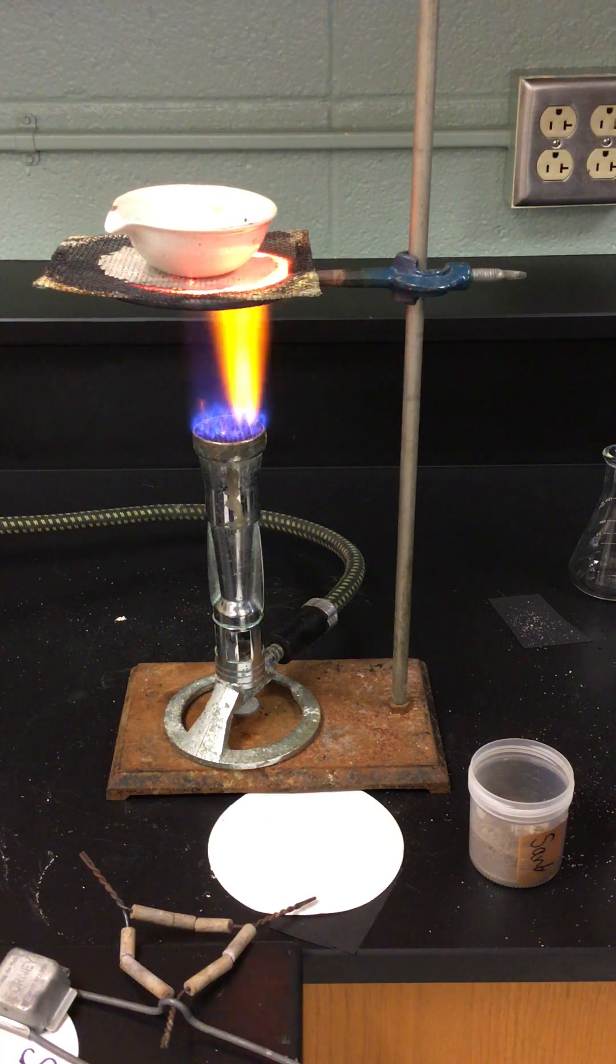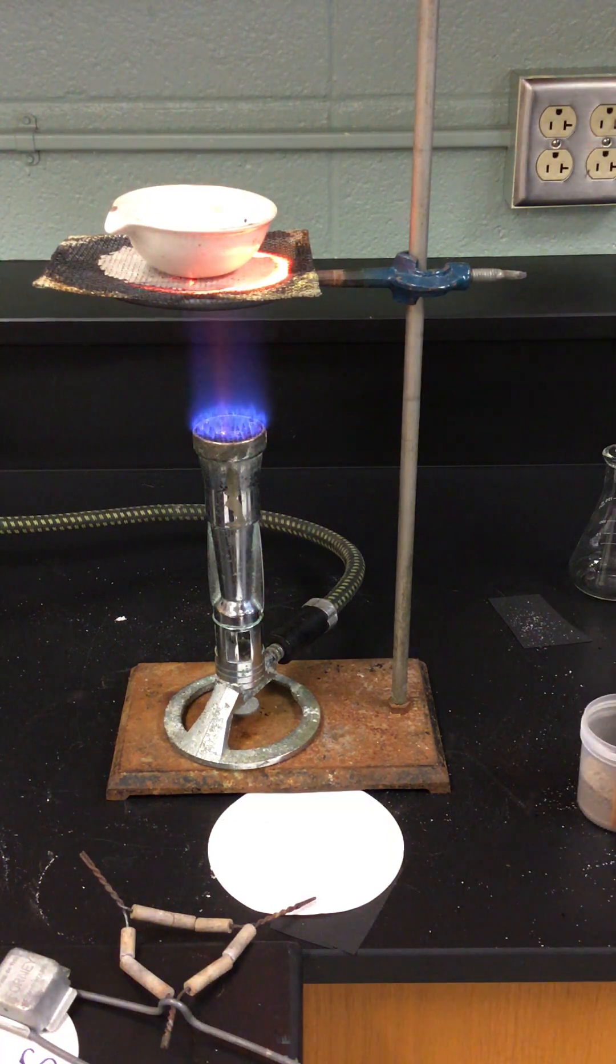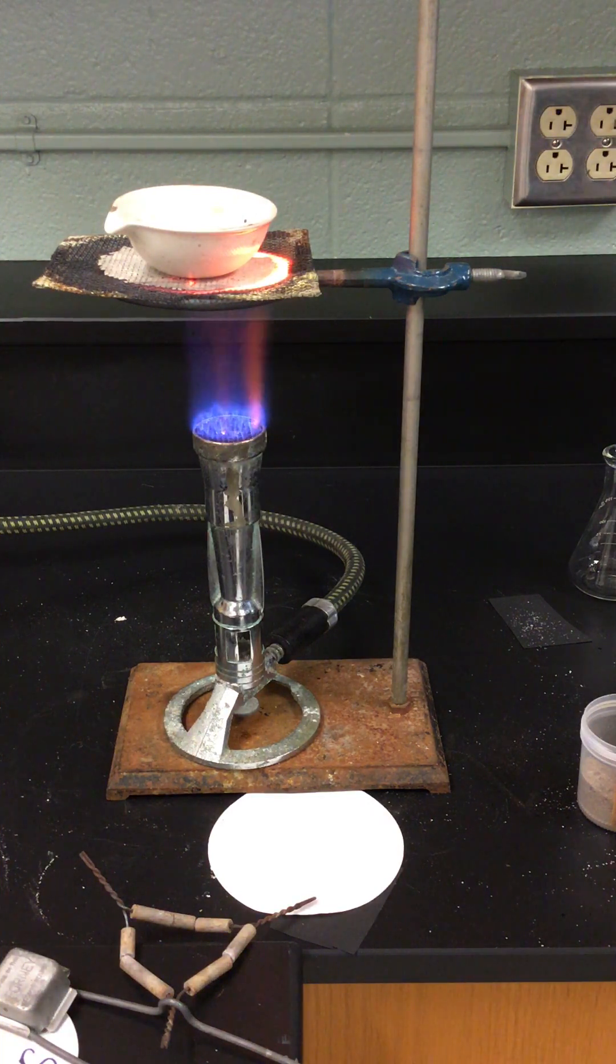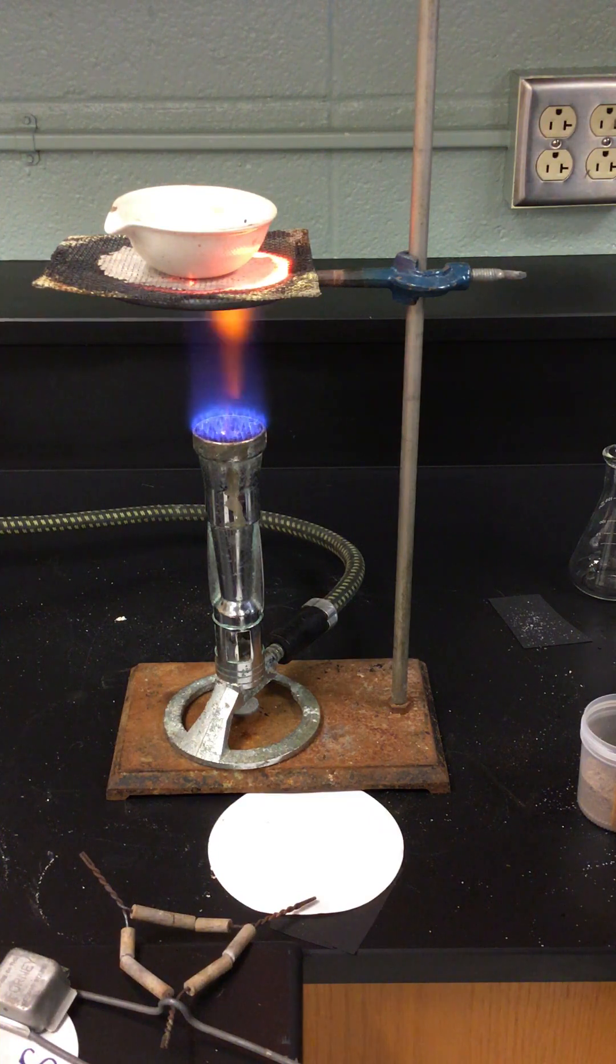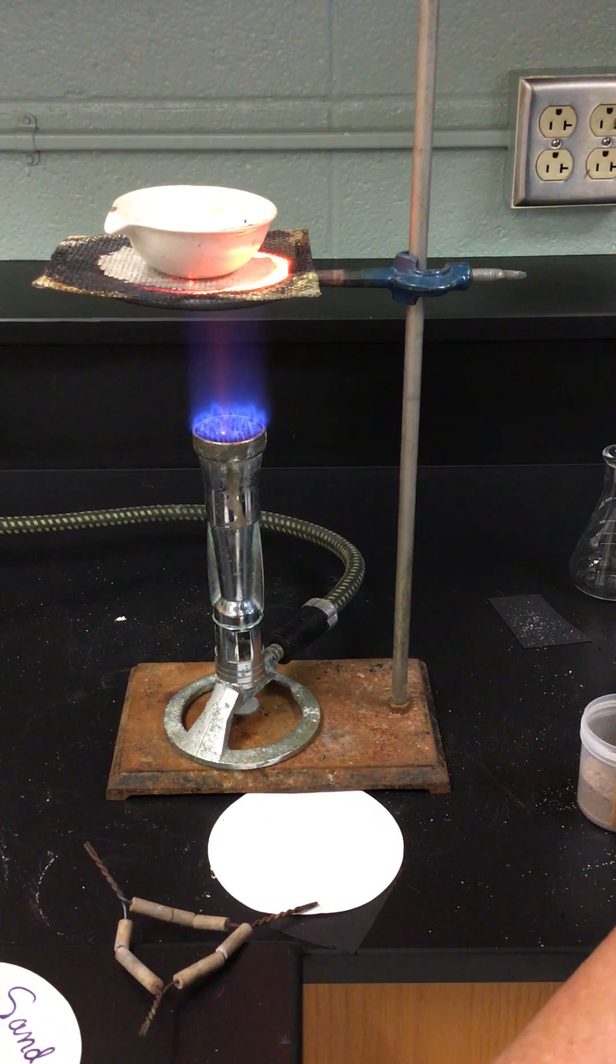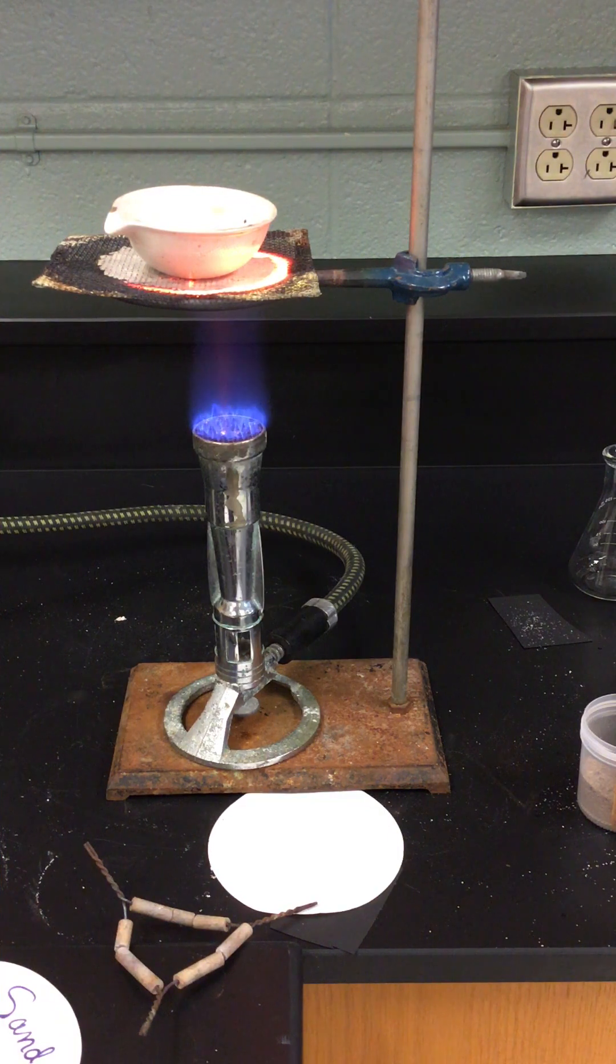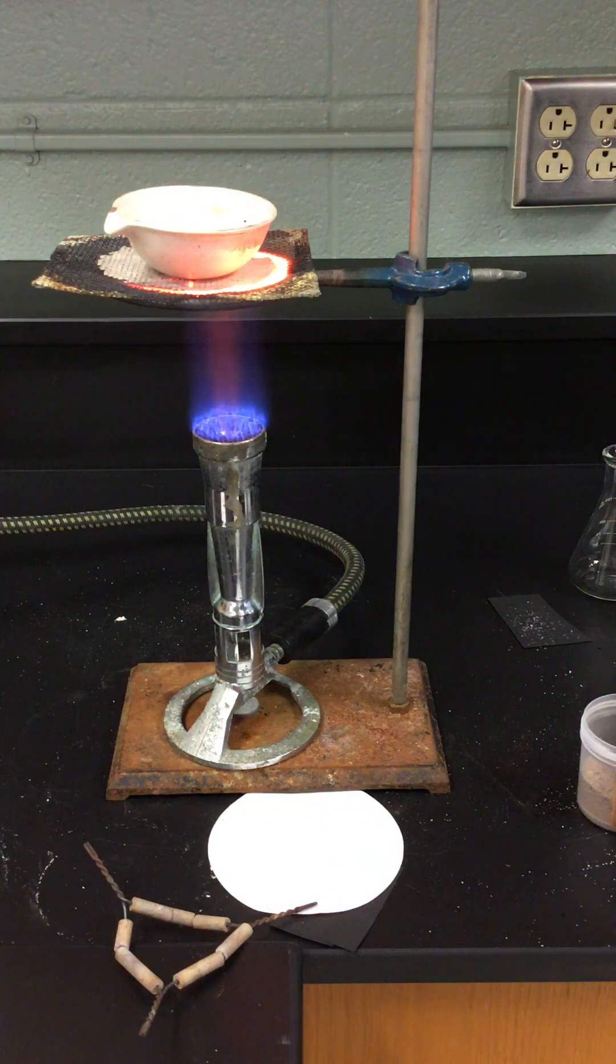If you were in the lab right now I would be telling you to use this time to work on your data tables. Let me look and see if there's anything else I can do here. I don't know if I have that second part with me. Perhaps I can find my spare piece of magnesium. I've got a little bit of magnesium. I've got to walk around to the other side of the table.